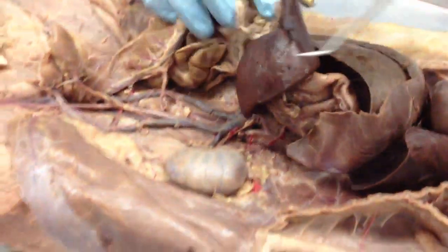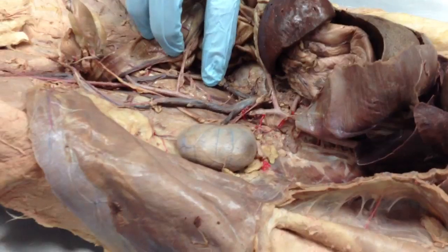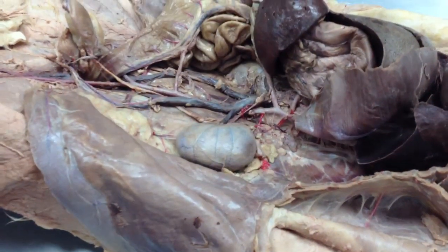I'm just wondering what that is. So this guy is really weird. Oh, I'm going to get to that in a minute.